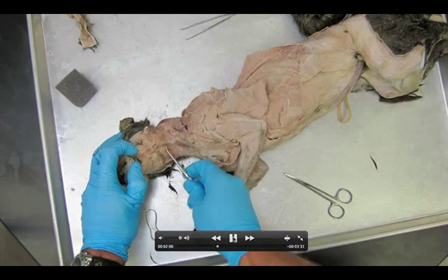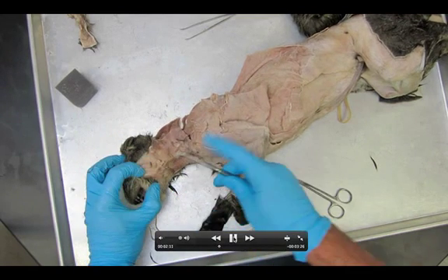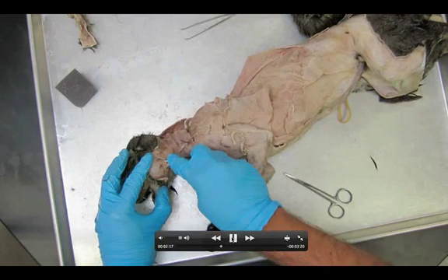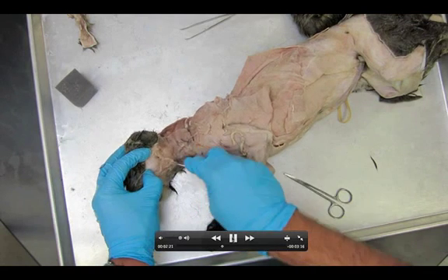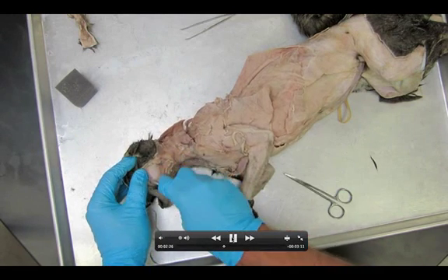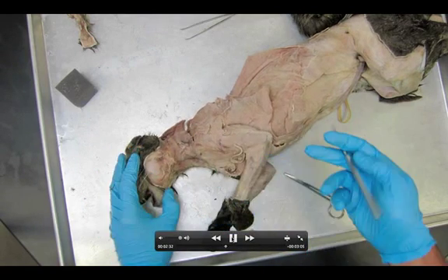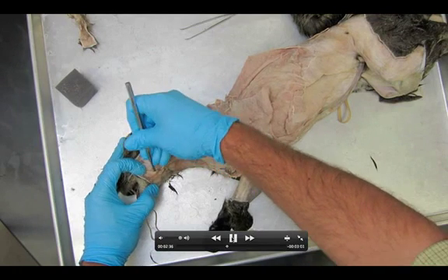The verb is called to masticate — masticating means to chew. I've got my probe underneath the jugular vein right there. What you're going to do is just remove any connective tissue you see and keep scratching down until you find this kind of shimmery, smooth surface. You should definitely see fascicle directions, and you'll see the masseter — it's what's going to pull the mandible up and down to make you chew your food.